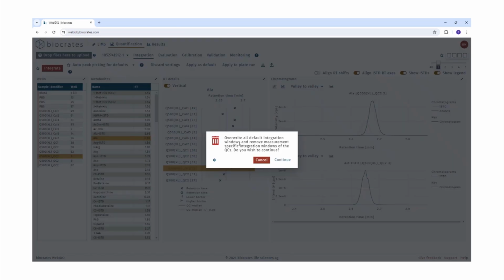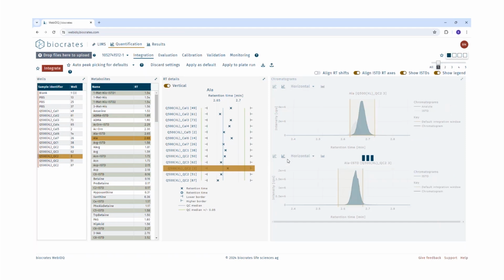After choosing auto peak picking for defaults, a warning will pop up about overwriting all default retention time settings. When that appears, click on continue. When the automated peak picking finishes, a purple bar next to the samples or some of the metabolites indicates that WebIDQ couldn't find a peak or has low confidence about the current peak. So the second tip here is to review these confidence indicators in the metabolites list and update any metabolite where the integration windows were incorrect or not defined at all, until the purple sample indicator disappears.